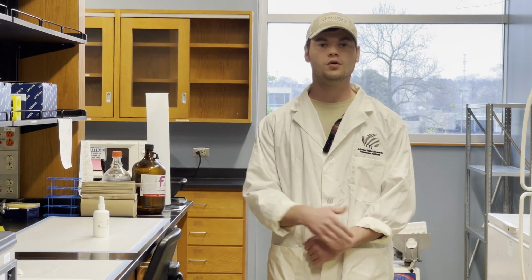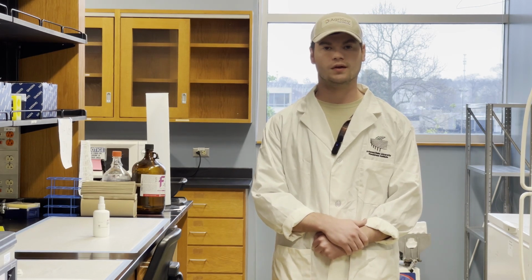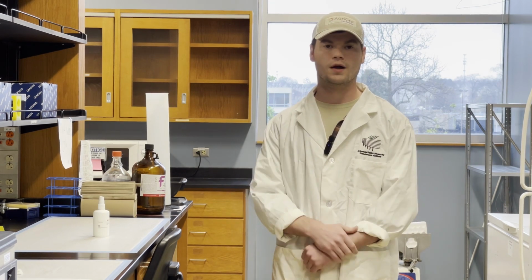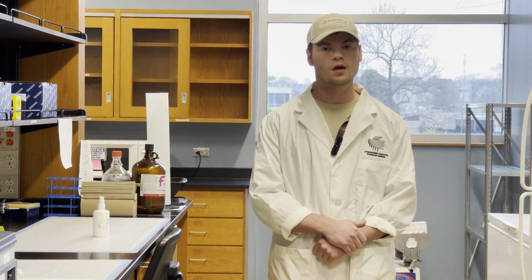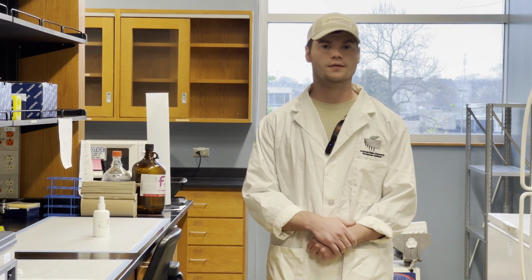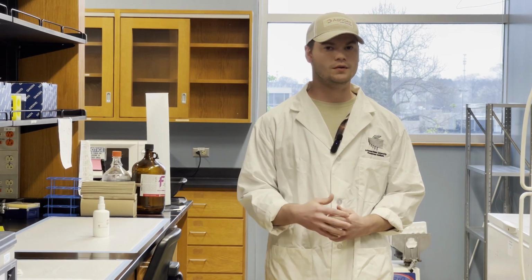So what we're doing today is using a technology called Oxford Nanopore 16S barcoding and sequencing to look at the microbiome structure following Fusarium virguliforme infection in soybean. Oxford Nanopore has several advantages over other methods of amplicon sequencing to look at the microbiome. One of the major reasons that we're interested in Nanopore is because it leverages long-read sequencing, which allows us to look at multiple hypervariable regions in a marker gene.